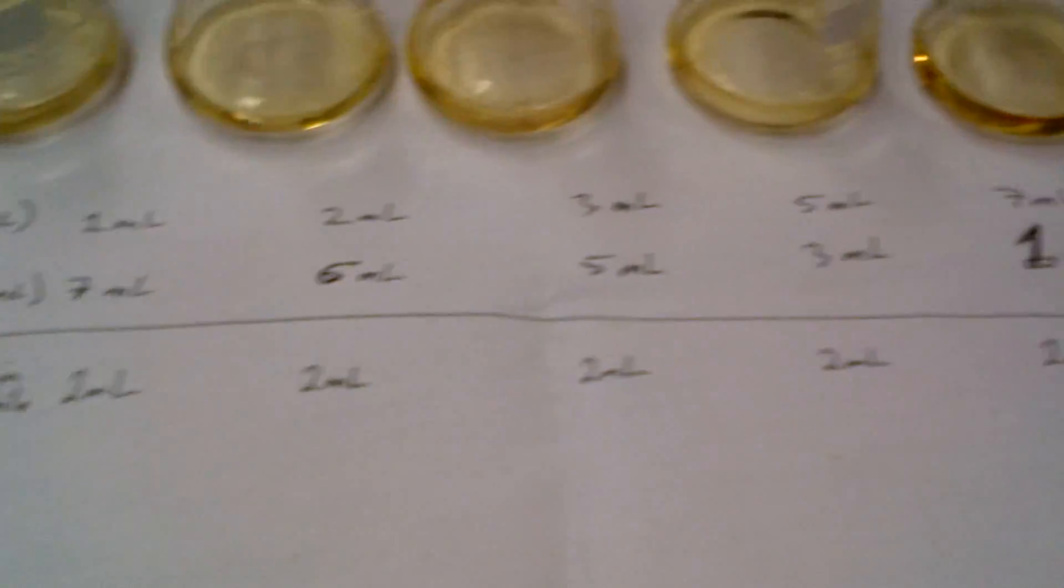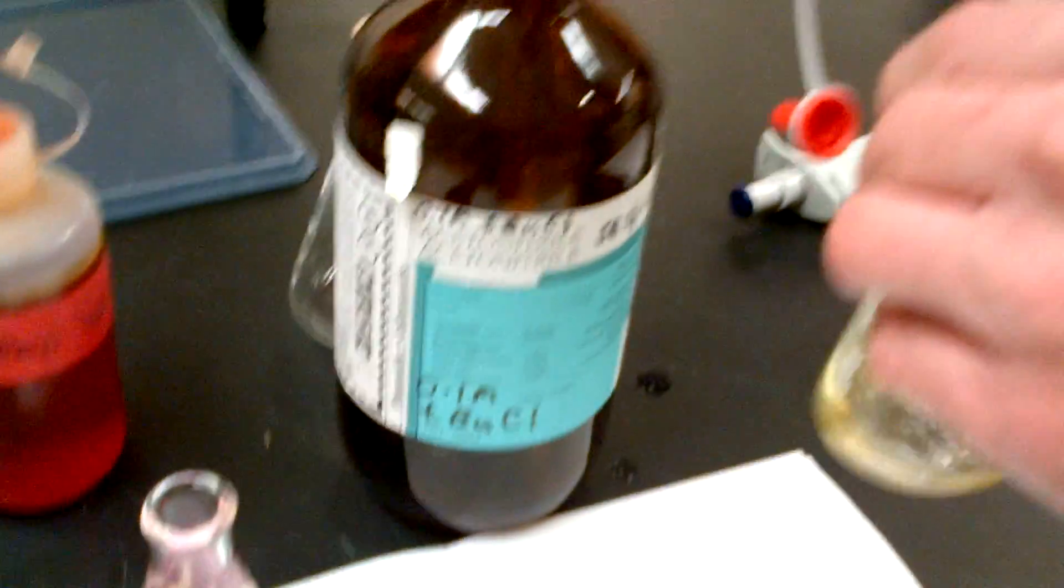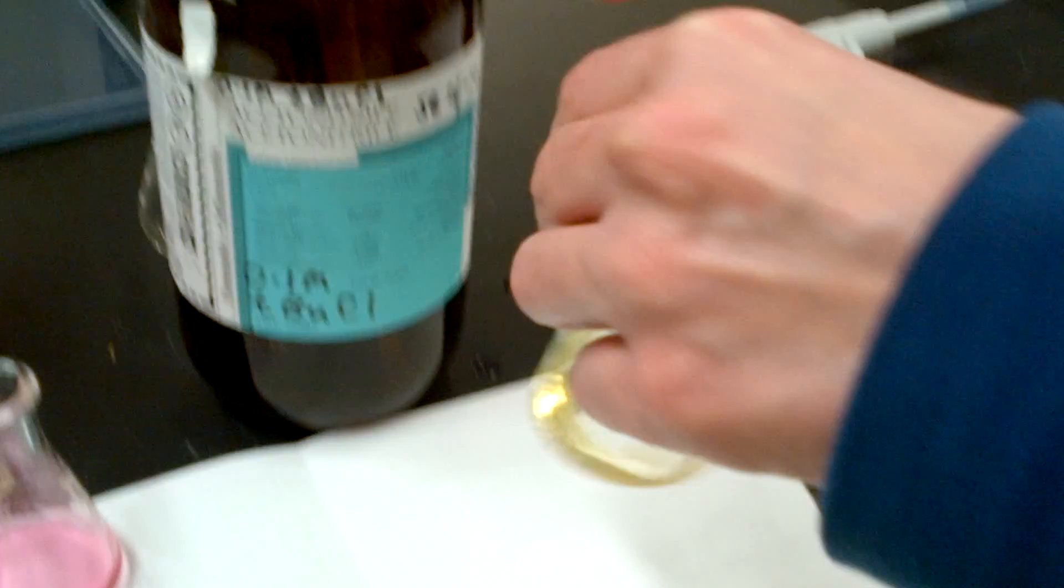To do this experiment, we have to set up a whole bunch of different solutions, and then we have to add this acetonitrile solution of T-butyl chloride. Thank you, Jen. Jen's just done that for us.